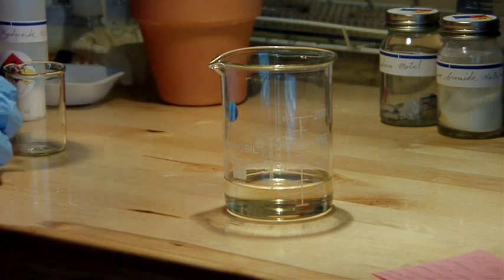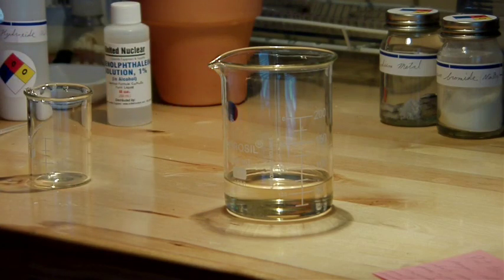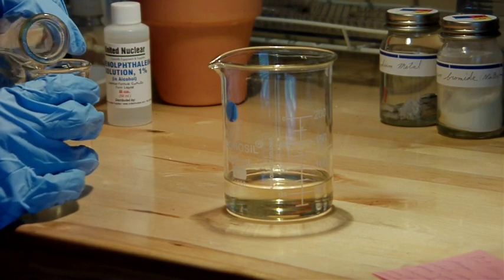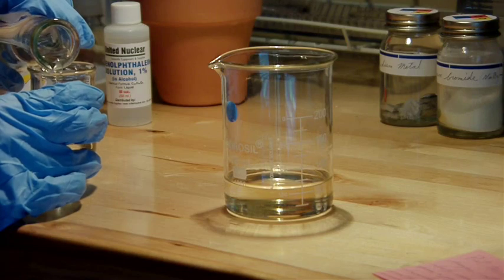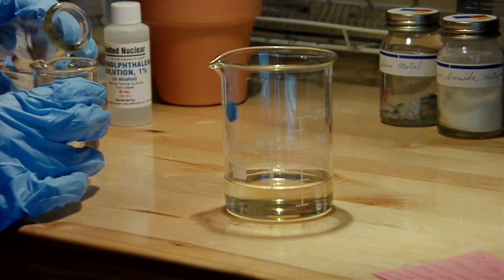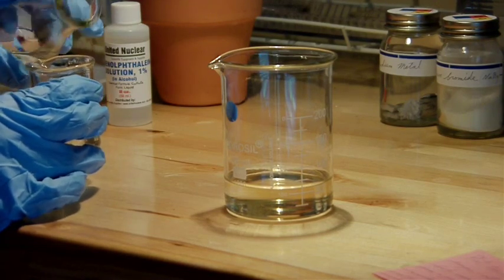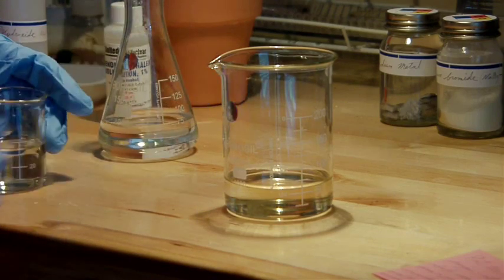So to start I'm going to add sodium hydroxide fairly quickly. Because I've estimated that I should need most, if not all, of the 100 milliliters that I prepared here.